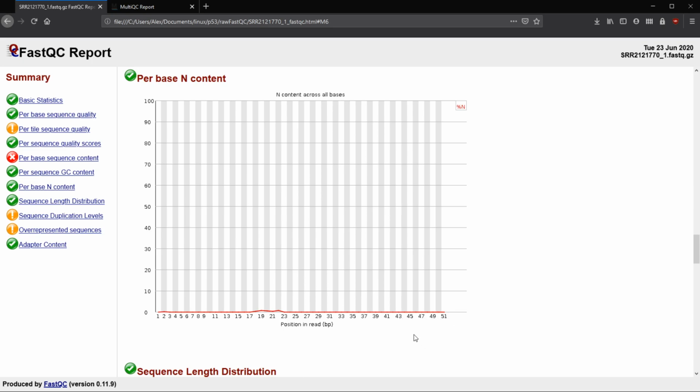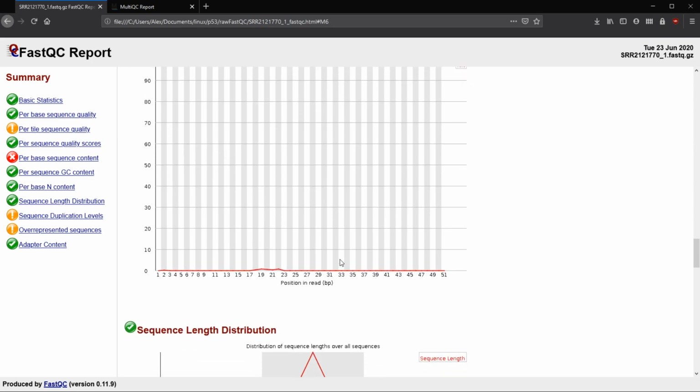And if we have an N content greater than 20% at any base location, then we're going to have a failure of our per base N content. It just gets to be too many unknown.